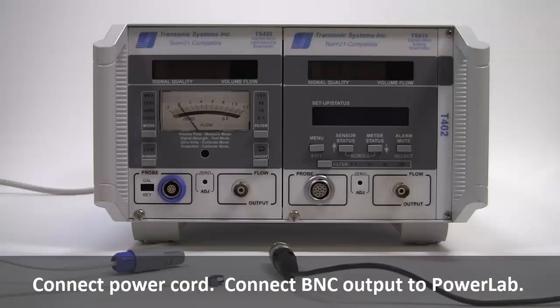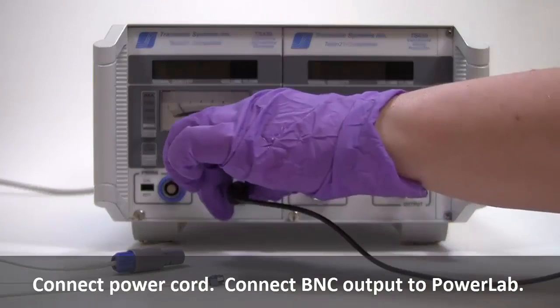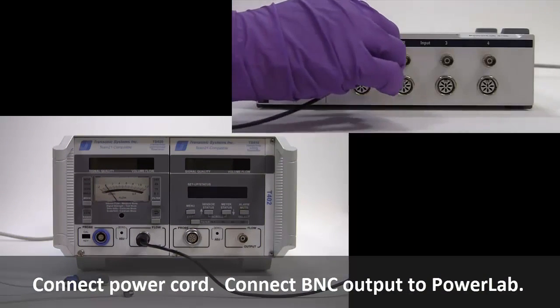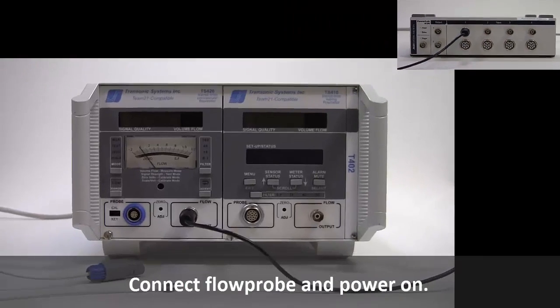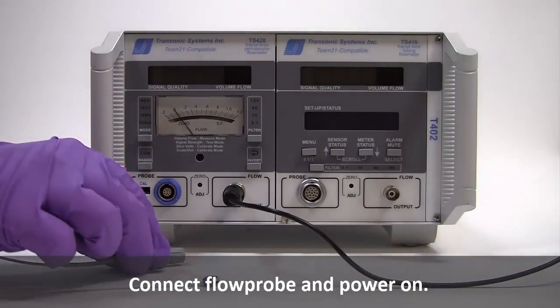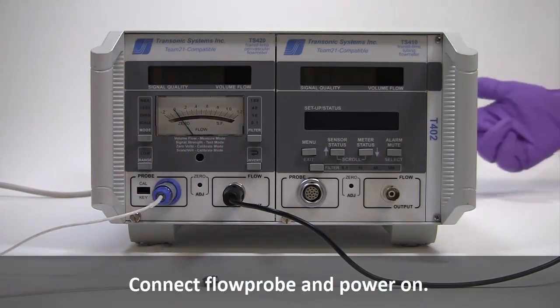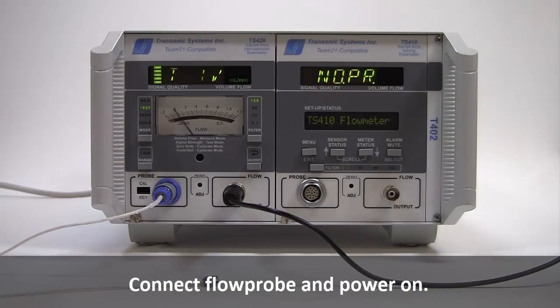We begin by connecting the power cord. Next, connect the BNC flow output to a PowerLab. Then, connect a flow probe to the front panel and power on both the module and the PowerLab. The display will scroll the probe size and no signal until liquid is present in the flow probe.